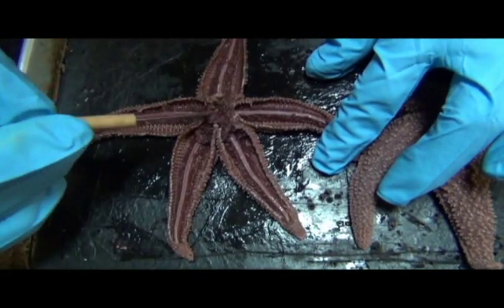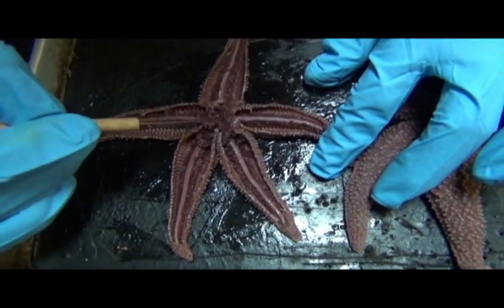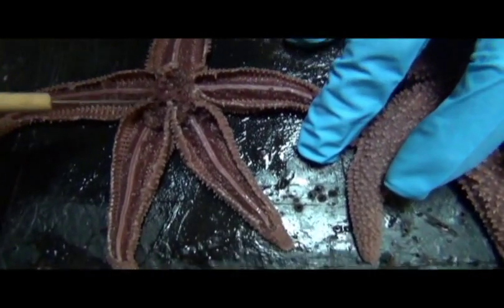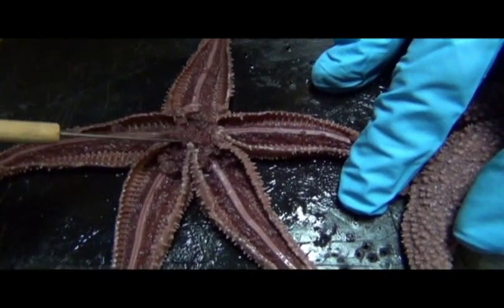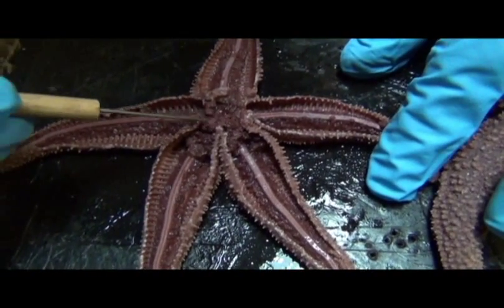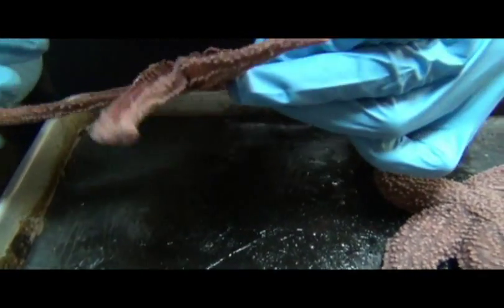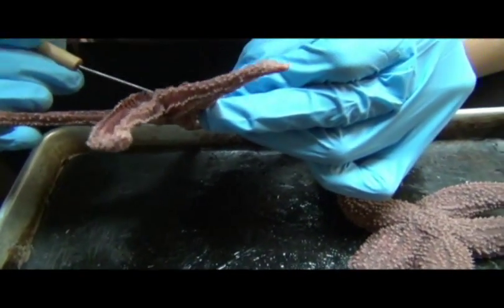Okay. The one structure that I didn't really get a chance to talk about is the stomach, which you can actually see here. This is all stomach. Okay, and it usually doesn't preserve well, but this is a thing that would leave the animal when it's about to digest something like a clam.